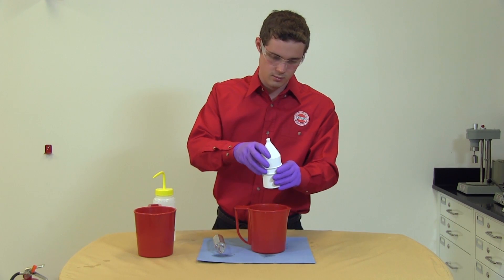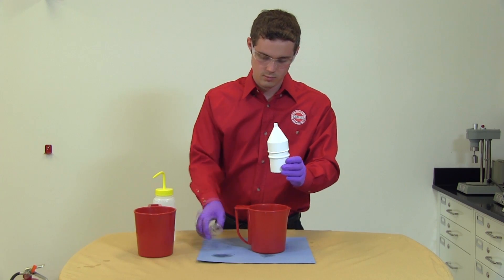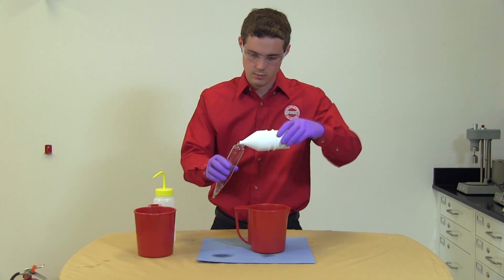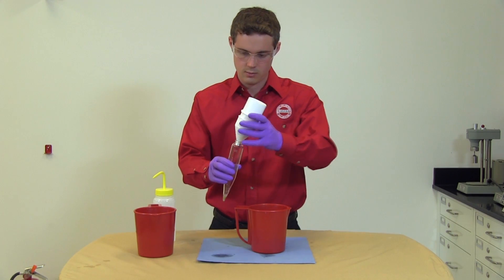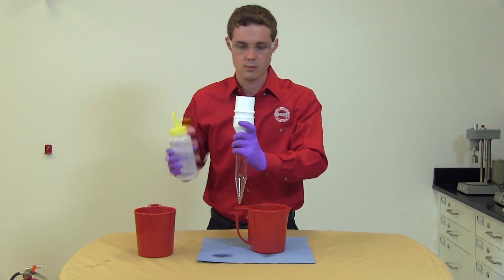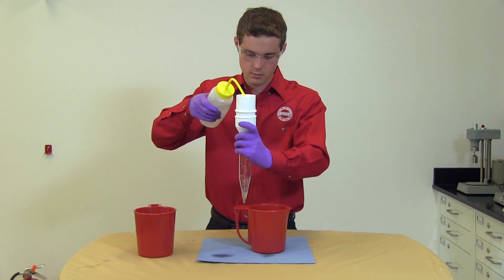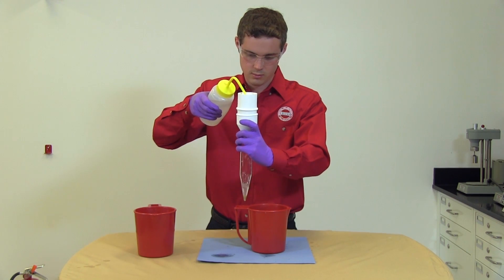Attach the funnel, invert it over the sand content tube, and rinse the sand off the screen and into the sand content tube.